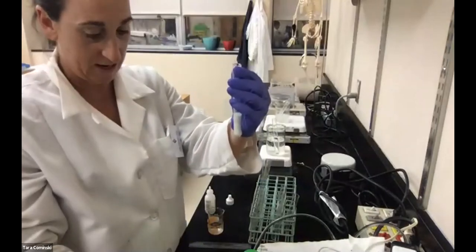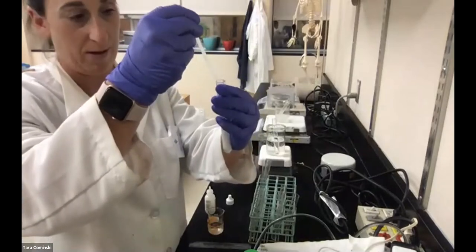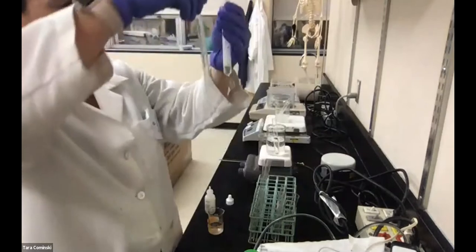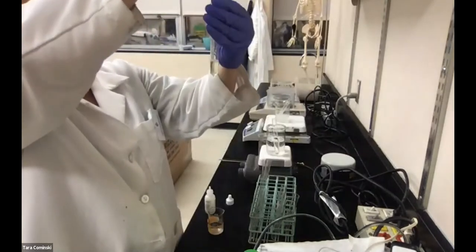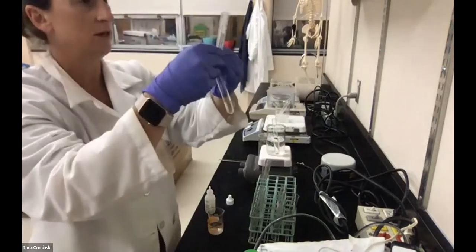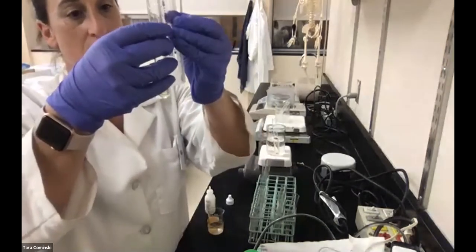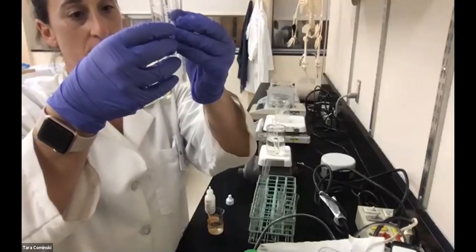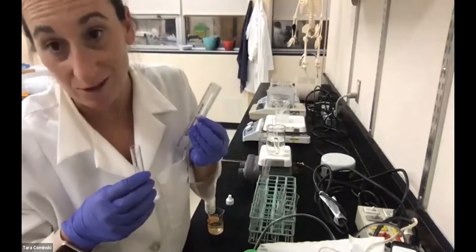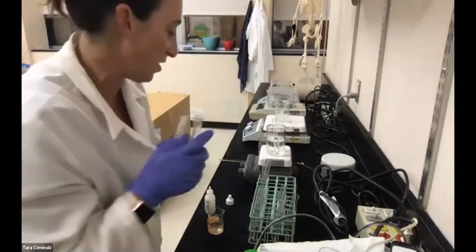Whoa, this is some crazy reaction with the peroxide and catalase. Usually when I do this, it doesn't work this well, by the way. I'm going to quickly measure that. Sorry, one second, let me flip this around. So I'm going to go with what happened initially. I will call that 50 millimeters. Okay, so 50 millimeters for tube 1, which was in the refrigerator.